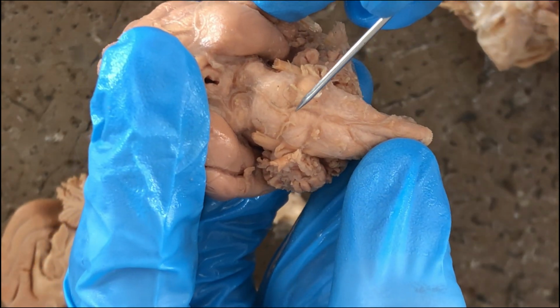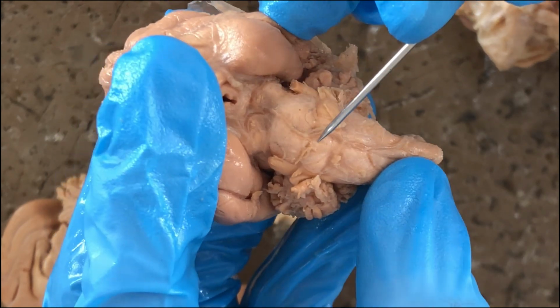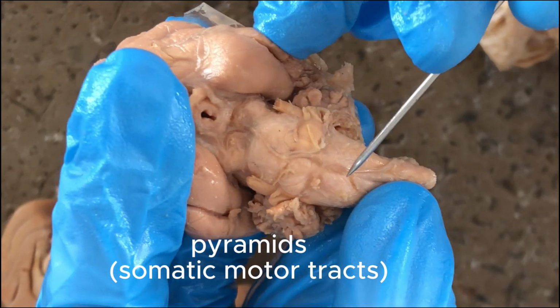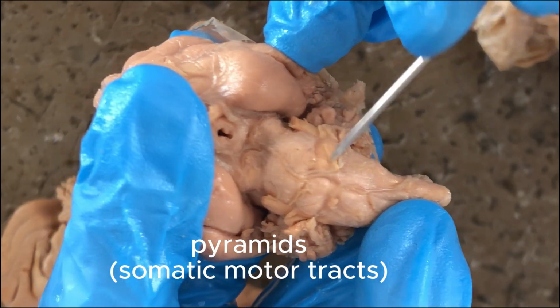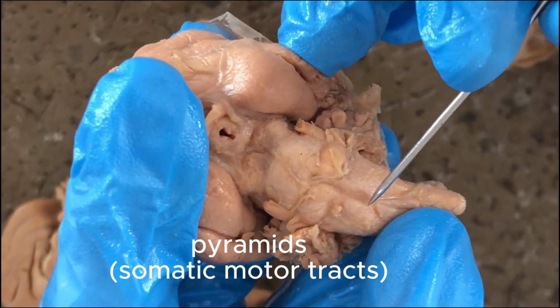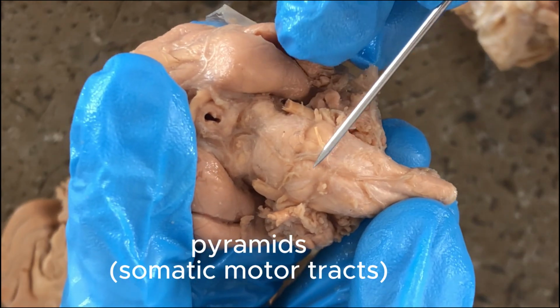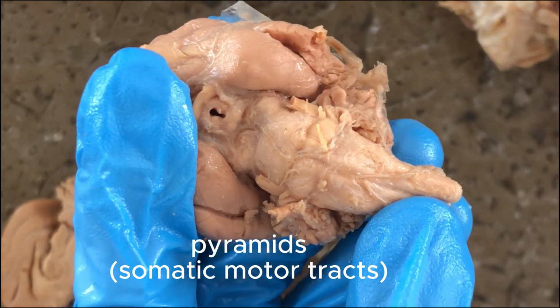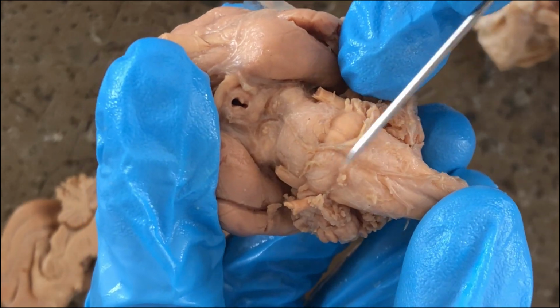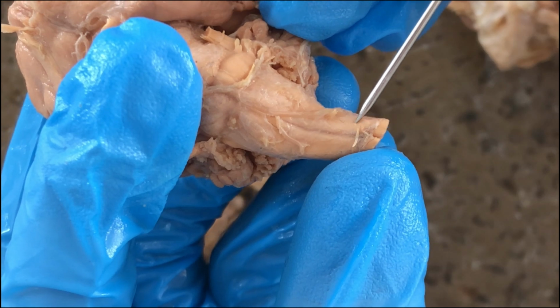And these longitudinal bands here are the pyramids or the somatic motor tracts. Motor tracts carrying motor impulses from the higher brain regions down to the spinal cord to control the skeletal-muscular system, for example. Somatic motor tracts or pyramids, and then this would be the spinal cord already.